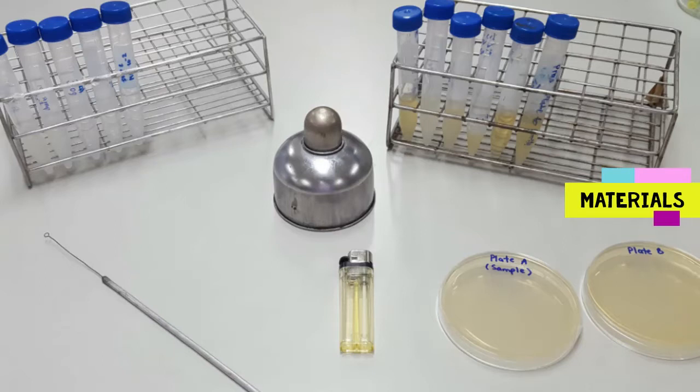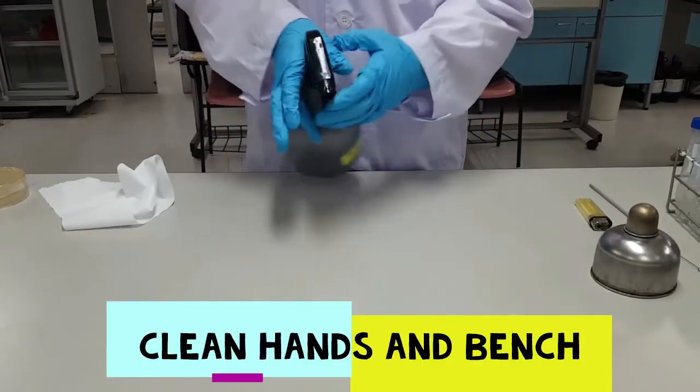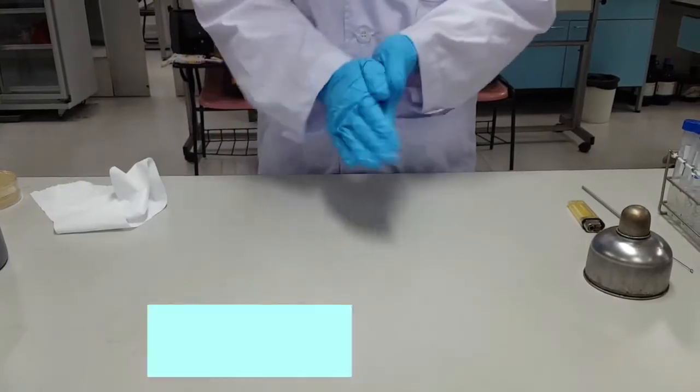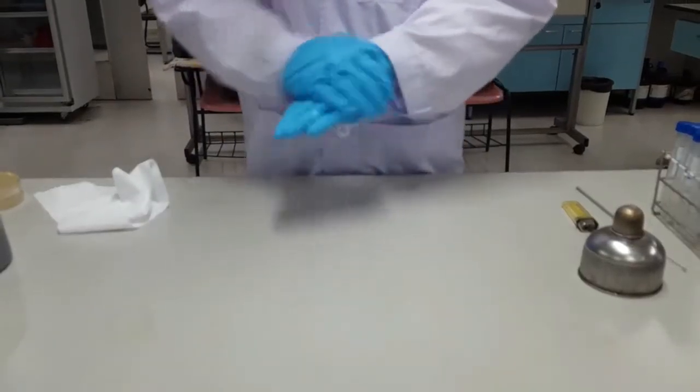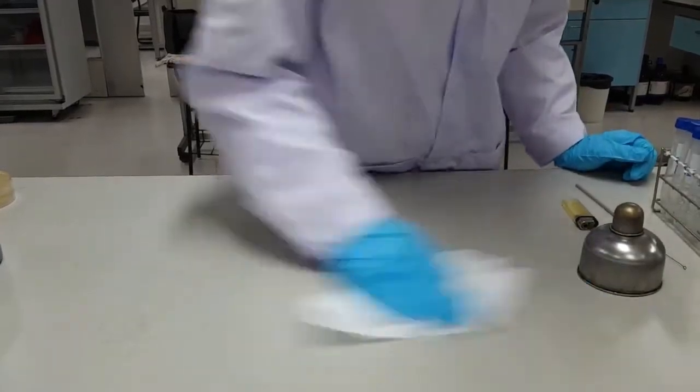The inoculating loop is what we're going to be using today to transfer bacteria. The inoculating needle can also be used. An alcohol lamp will be used to heat and kill microorganisms. You want to start by first spraying your hands and lab bench with 70% alcohol to kill the microorganisms. If you use 95%, it may evaporate too quickly before killing the microorganism.